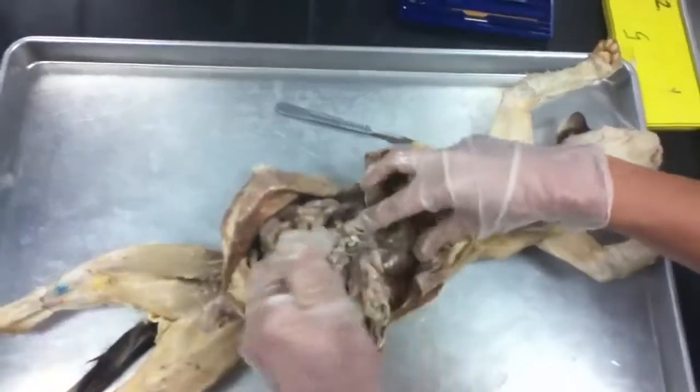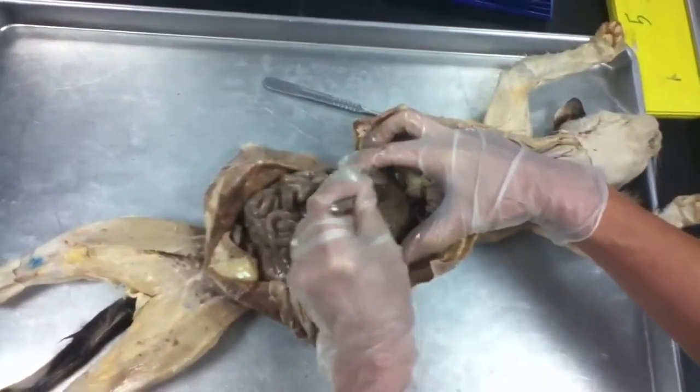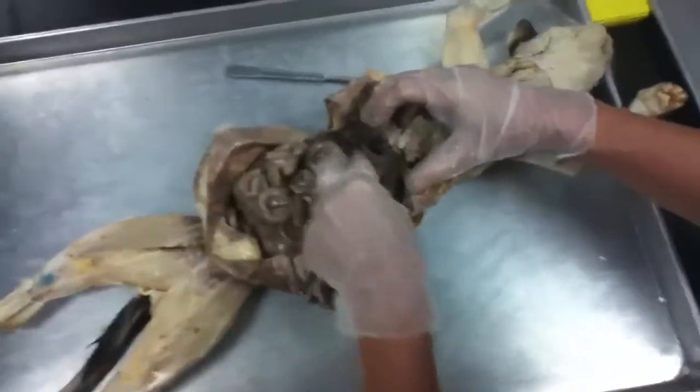If we go back to the right medial, what do you have kind of sandwiched inside of it? The gallbladder, okay? So there's that gallbladder. Usually a green sac, sometimes it's not green, but you still should be able to see like a sac of tissue sitting there, all right?